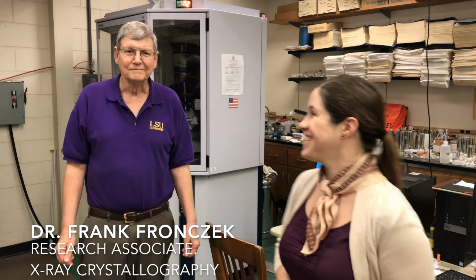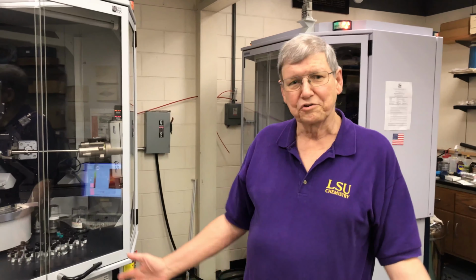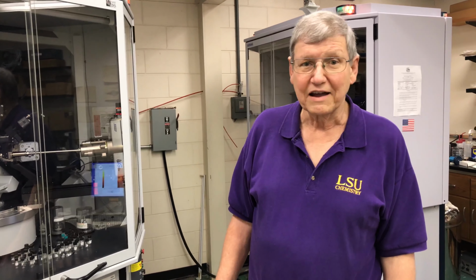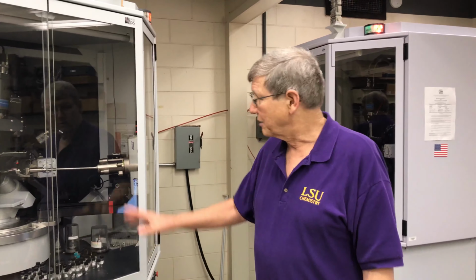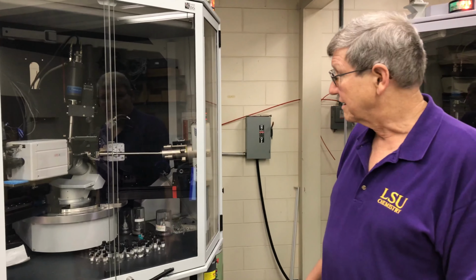This is Dr. Frank Fronczek. He is the expert in charge of our X-ray crystallography facility. Hi, welcome to the X-ray Lab. I'd like to show you what instruments we have and give you an idea of what we do here. We have two single crystal X-ray diffractometers.